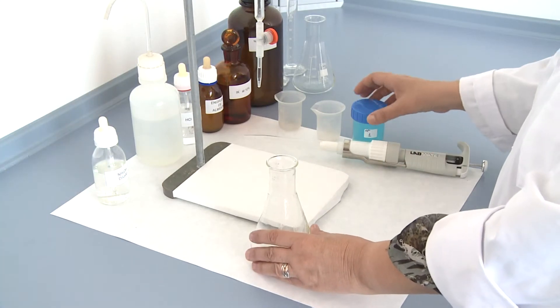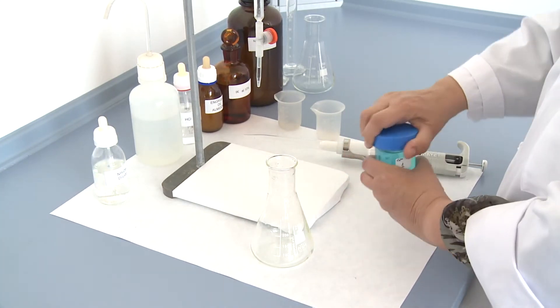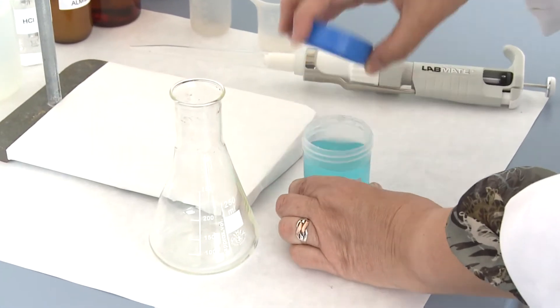Take 10 ml of water and transfer it to an Erlenmeyer.